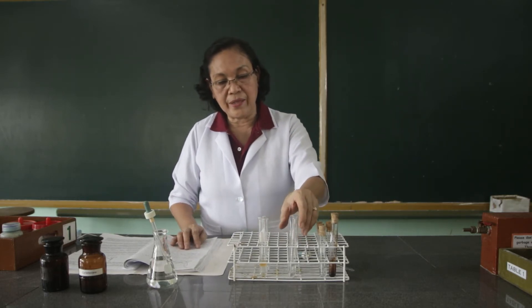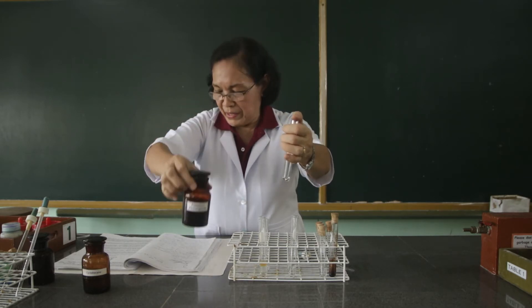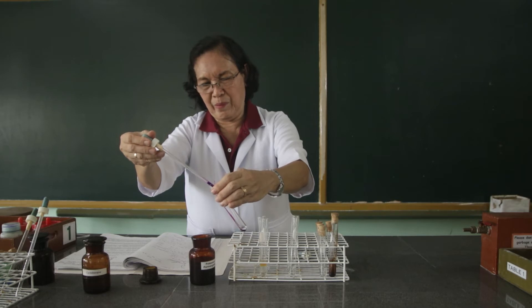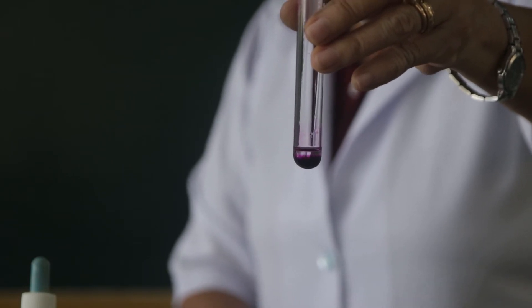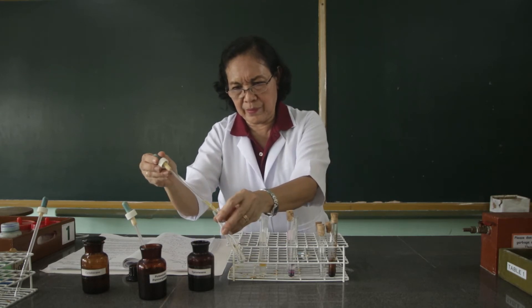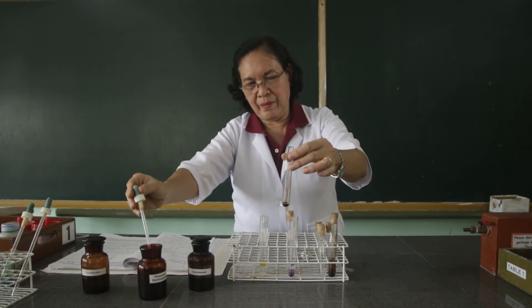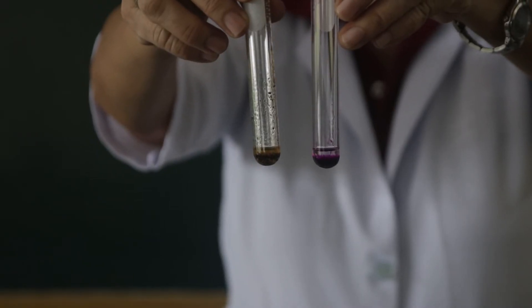The next test that we are going to apply to these hydrocarbons is the reaction with potassium permanganate. Let's start with the cyclohexane. With this cyclohexane, I'm going to add 5 drops of the potassium permanganate. Observe what happens. Then we are going to use the cyclohexene — we will use 5 drops — and add the potassium permanganate. Observe what happens and compare with the cyclohexane.